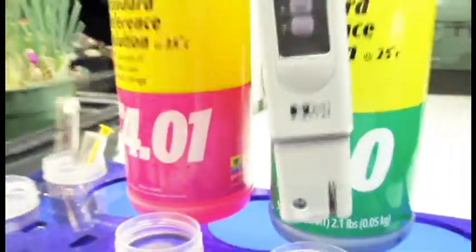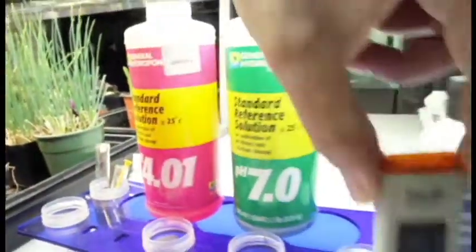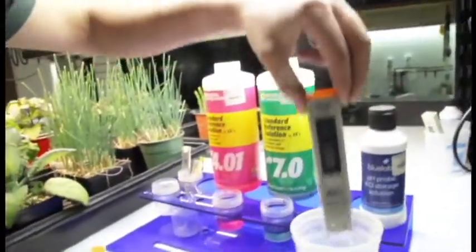Now I can take my meter out. It has been calibrated on both 4.0 and 7.0. I'm going to rinse it off. I'm ready to use it.